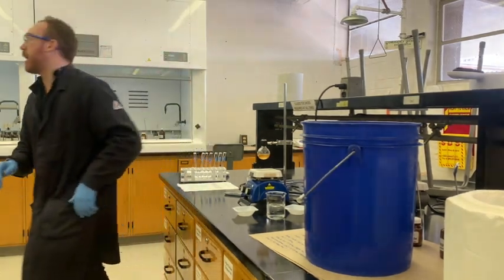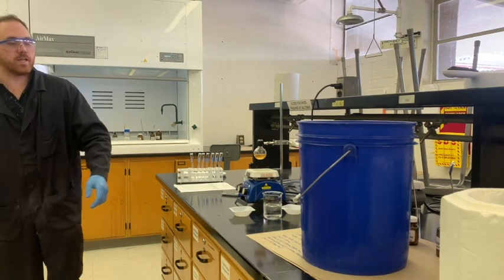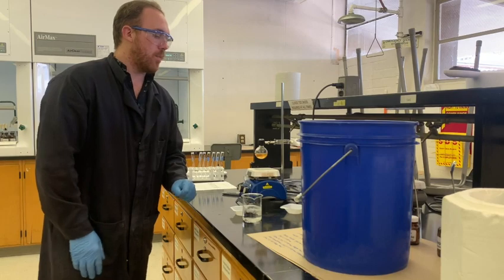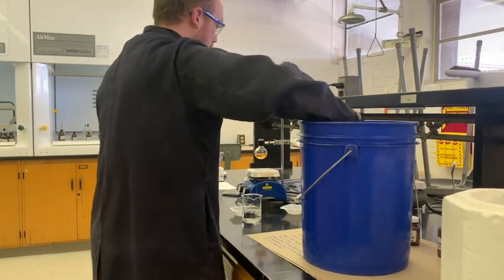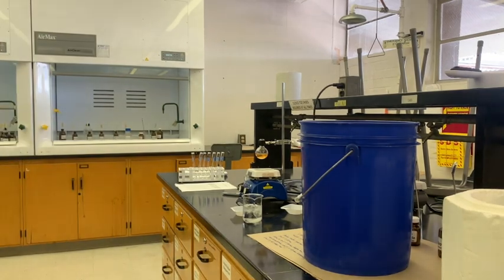So before I forget, and since the reaction is already mostly cool, we're going to sit it in this ice bath to cool the rest of the way. What I'm going to do is remove that stir bar before too much precipitate sticks to it.